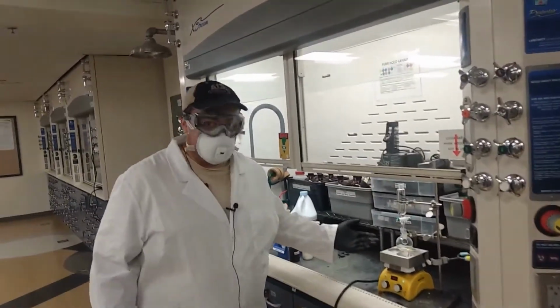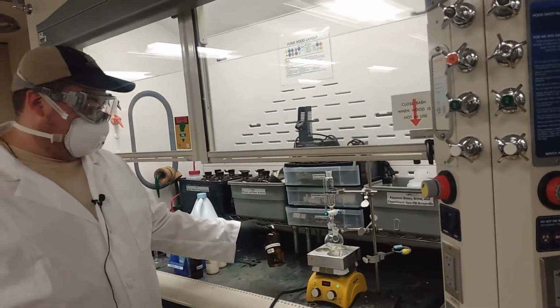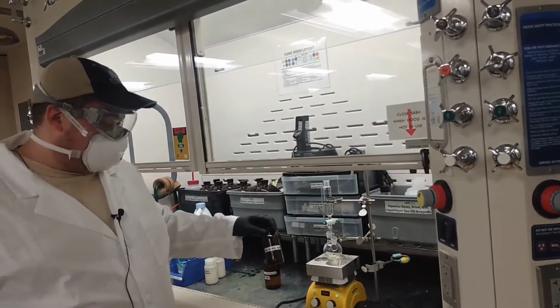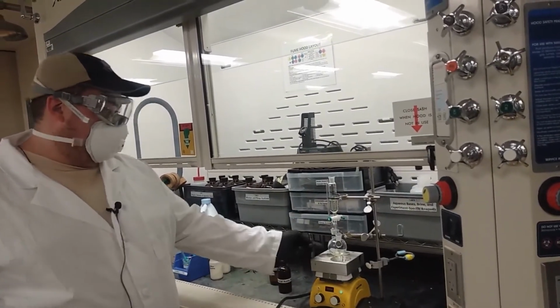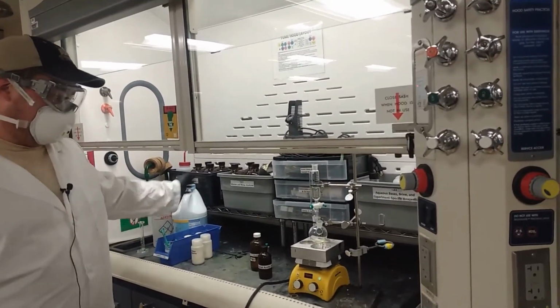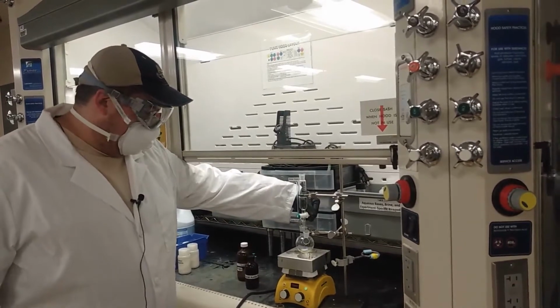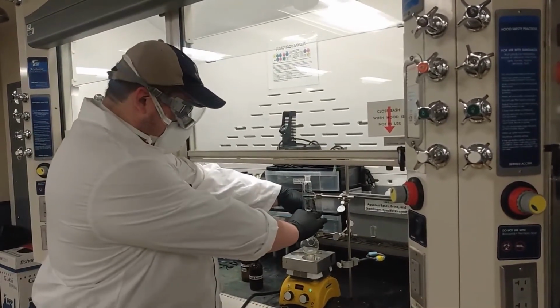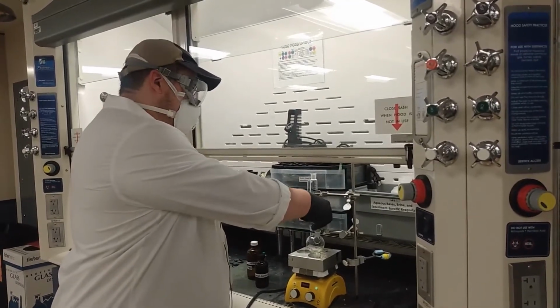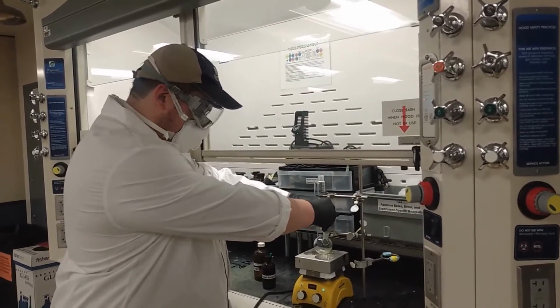Okay, so what I have set up here is 1 ml of 2-ethyl-1,3-hexanediol, 2.5 mL of glacial acetic acid in the round bottom flask, and then 15 mL of household bleach. So what I'm going to do now is set up the addition funnel to add the bleach slowly, and I'm aiming for adding it in roughly 15 minutes.